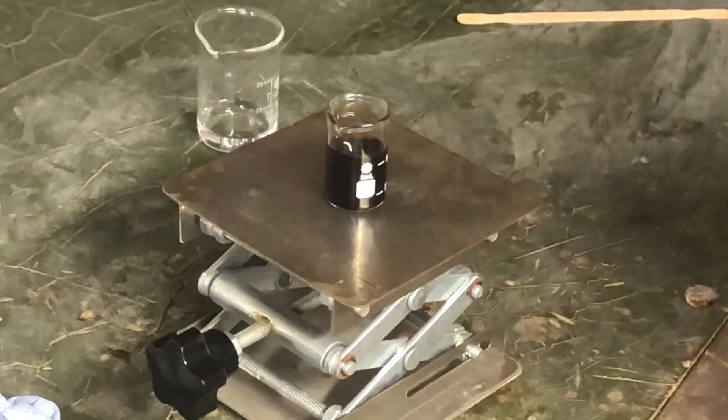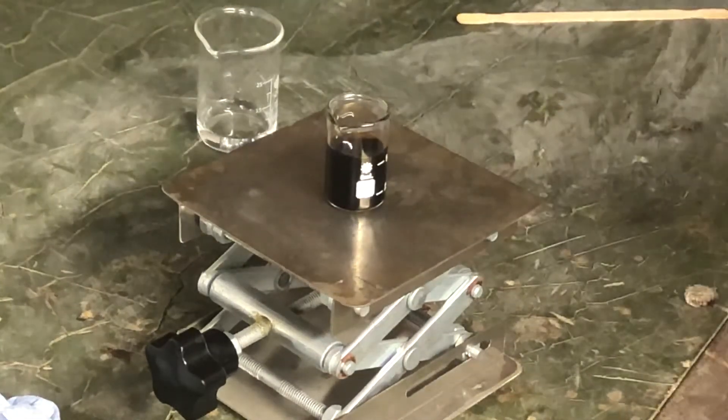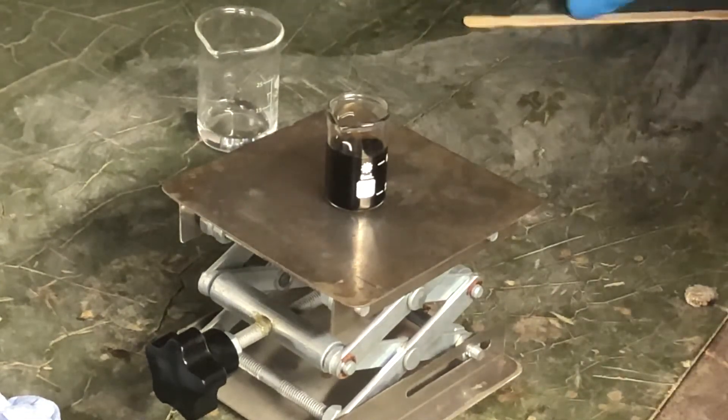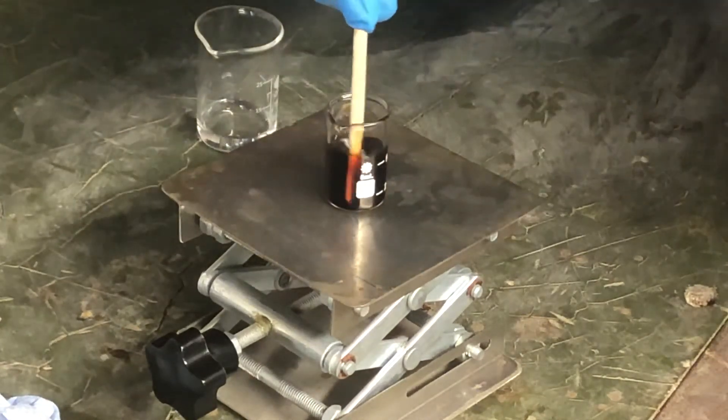I've got a bit more iodine, but I think I'll save that for other reactions. It's not that hard to produce, but it's a bit annoying because you have to do quite a bit of filtration and there's a whole acid catalyst and everything.